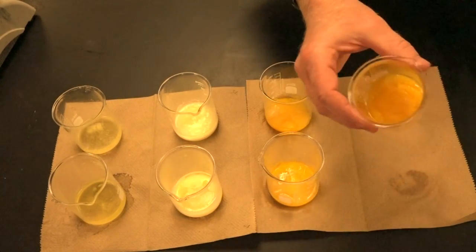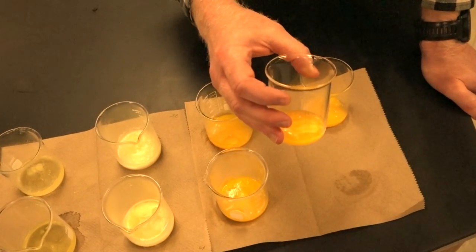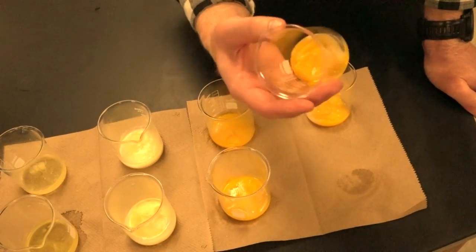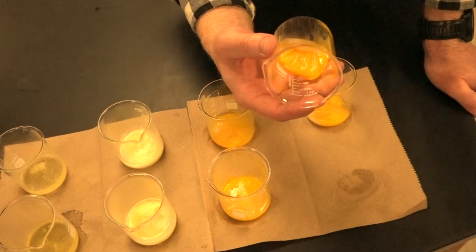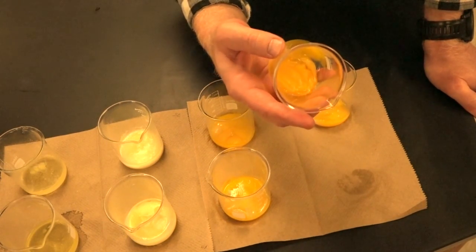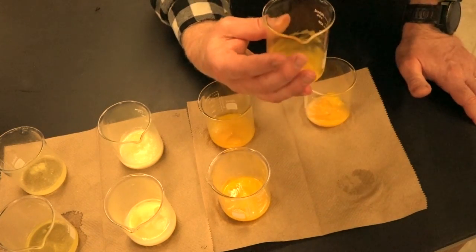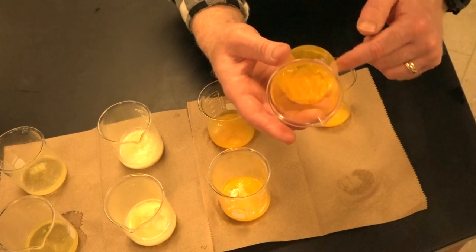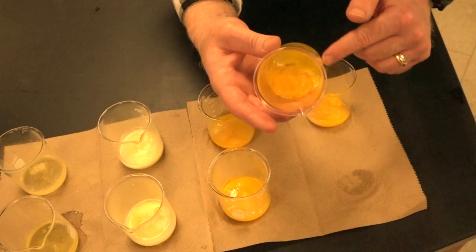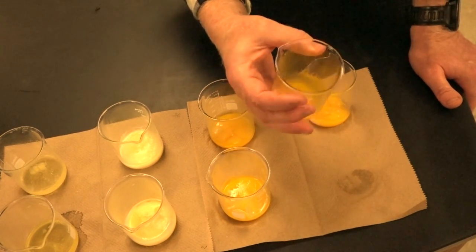But as we move over to, this is now 70 degrees, okay? And we're starting to solidify there. Still runny, but you can see up on this end that there's some denaturing happening right in this area. Is that coming through on the video? Good. So it's a little bit runny, but it's starting to gel up a bit.